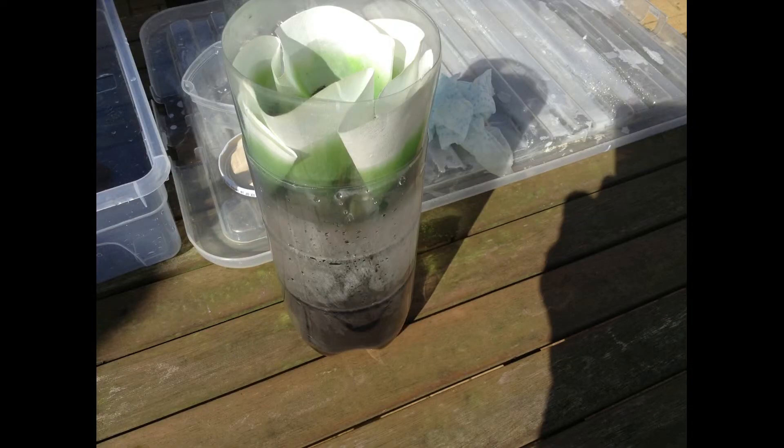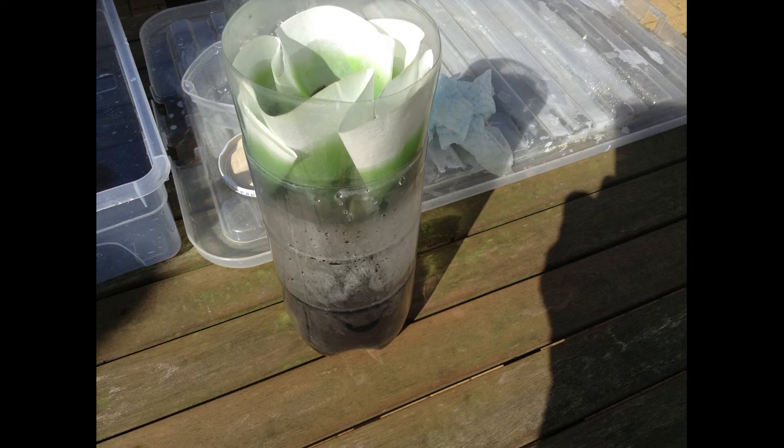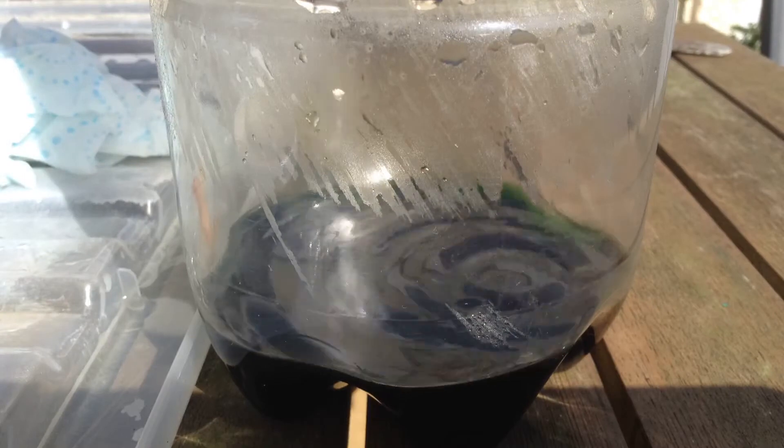Now here's just a picture of my professional filtration setup which I forgot to record taking place but I do have another brilliant time lapse to go with it.